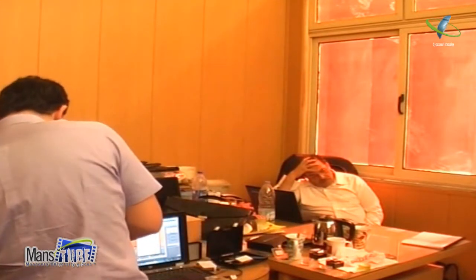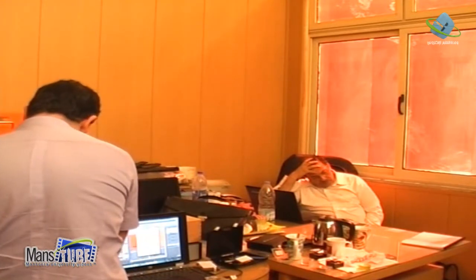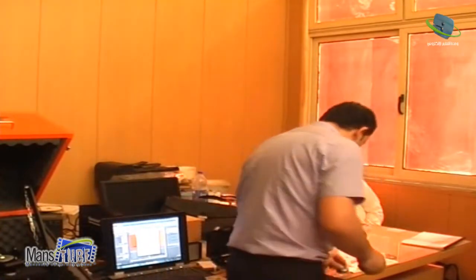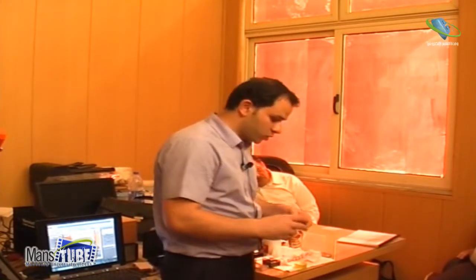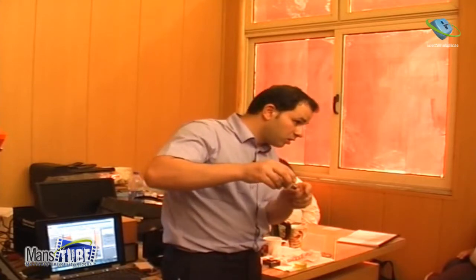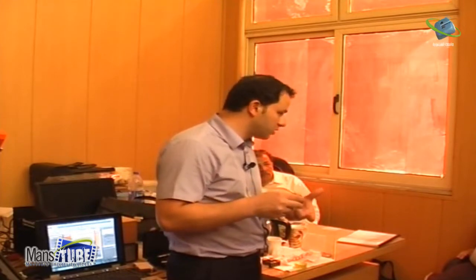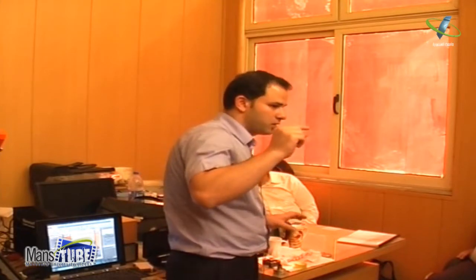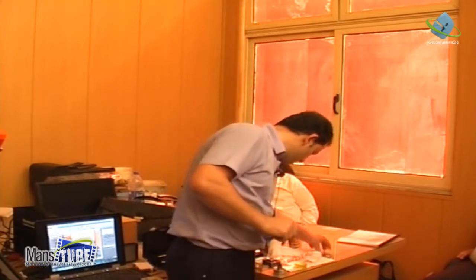So I put the cantilever, and now maybe I can show it. I put it here, and either you have your sample on a petri dish full of water. Of course, when you approach, the water should not be higher than this quantity. Otherwise, the AFM will touch the water, and there is an electrical connection. So you have to be careful: about 6 millimeters of water maximum. And now, for my sample, I will take water.